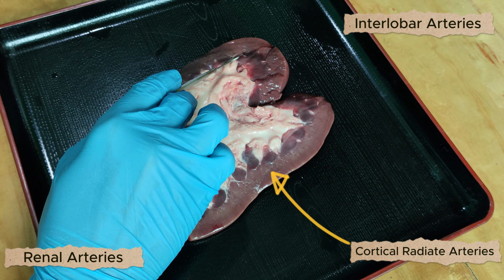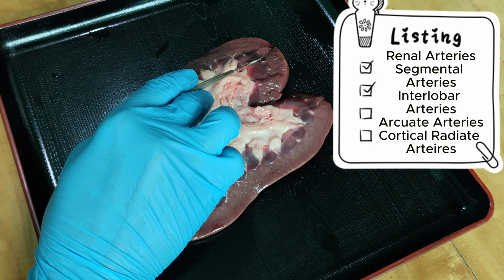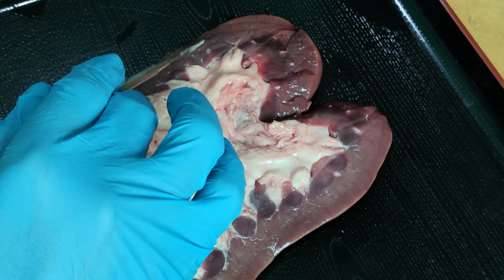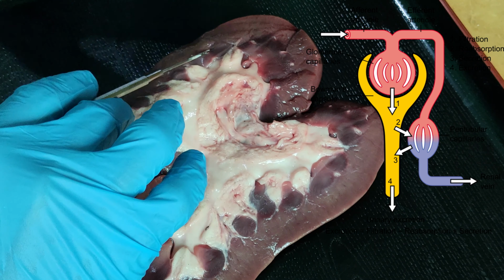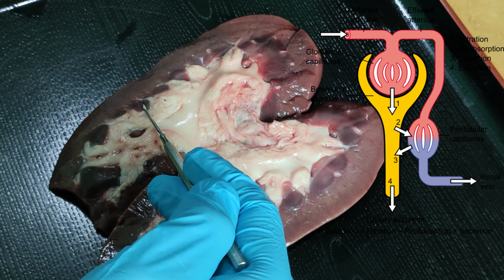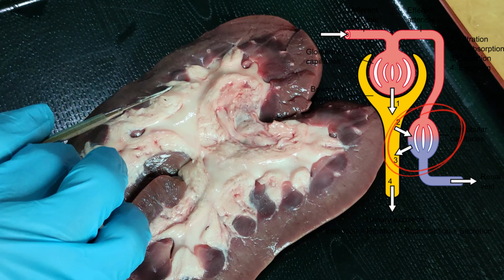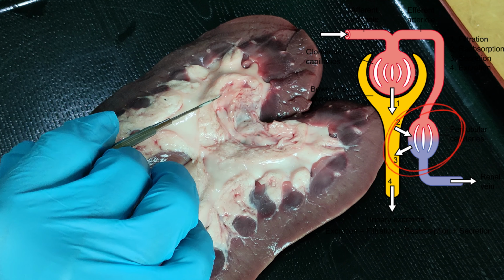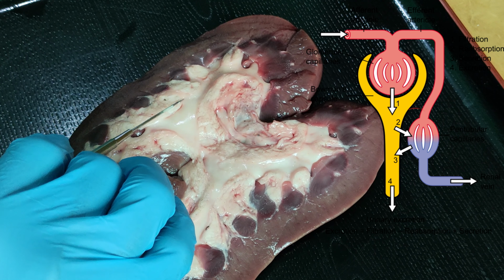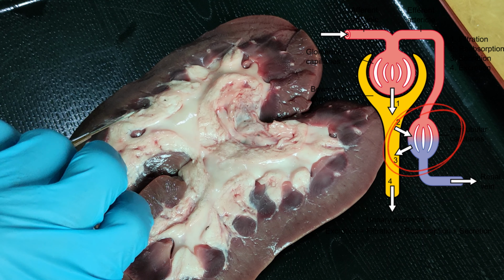These blood vessels serve multiple nephrons, while filtration of the blood occurs specifically in the glomerulus, where blood is supplied through the afferent arterioles. Once the blood is filtered, it exits through the efferent arterioles and then diverges into the peritubular capillaries, which supply the proximal convoluted tubules and the collecting duct, and into the vasa recta, which supply blood to the loop of Henle in the renal medulla.